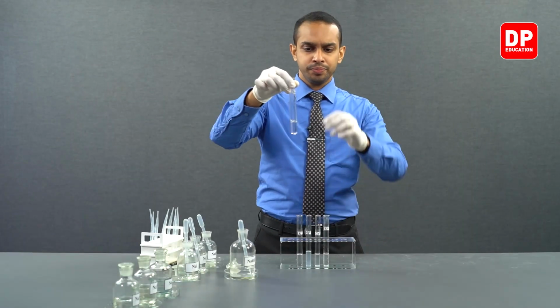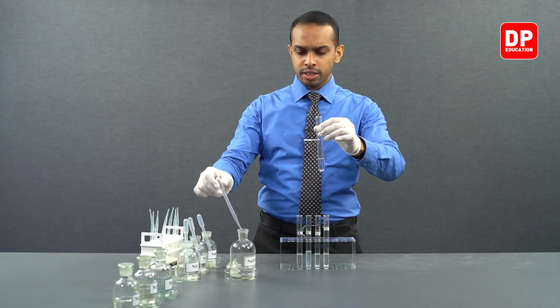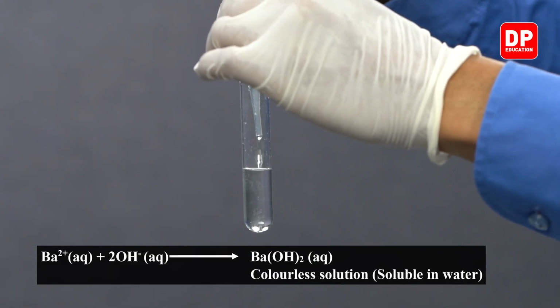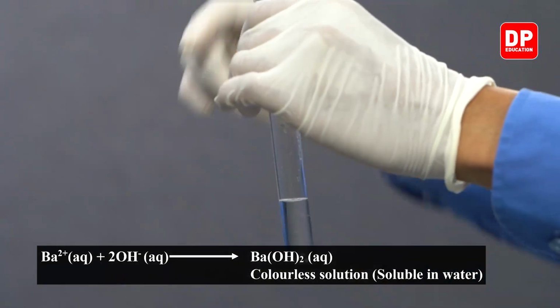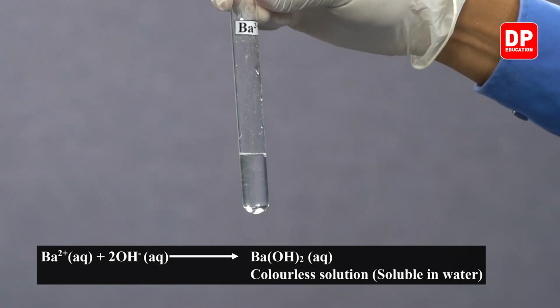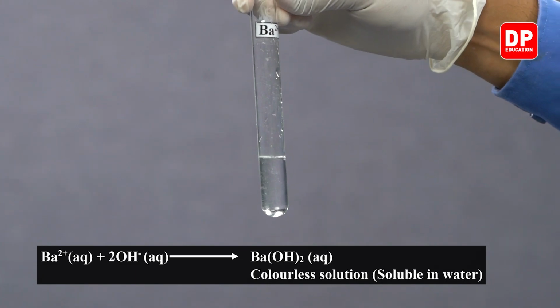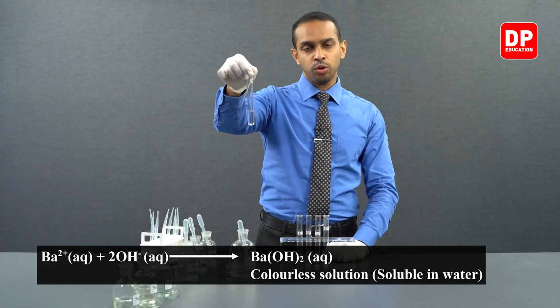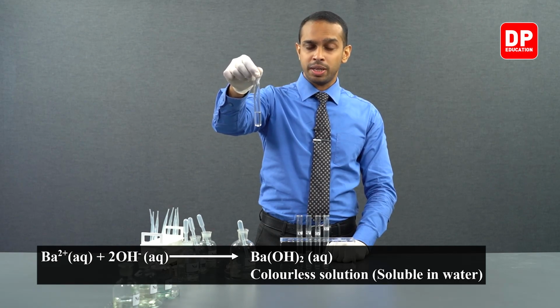As you can see, upon addition of a small amount of sodium hydroxide, let's add a small amount of sodium hydroxide again. You can see, we do not form a precipitate here. There is no formation of a precipitate.